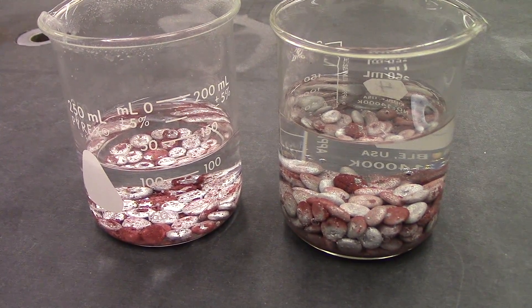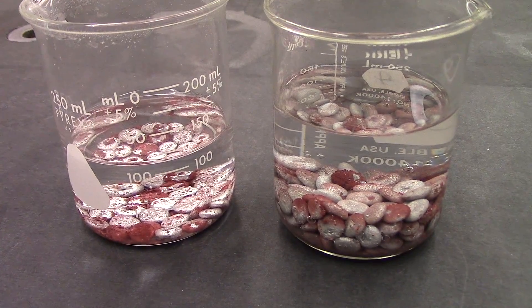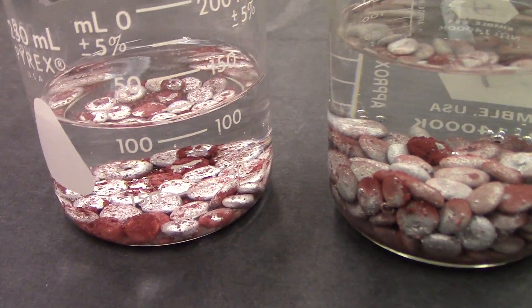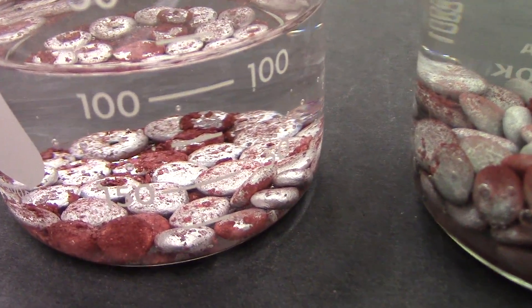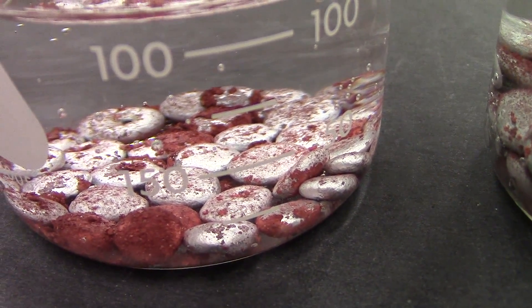It's been 72 hours now since I did my aluminum and copper sulfate reaction. We can see that there's been no change to the one that was heated, as that one went to completion pretty quickly sitting on the hot plate.